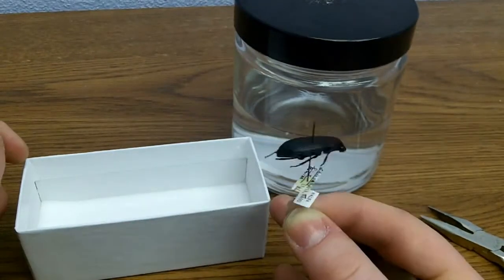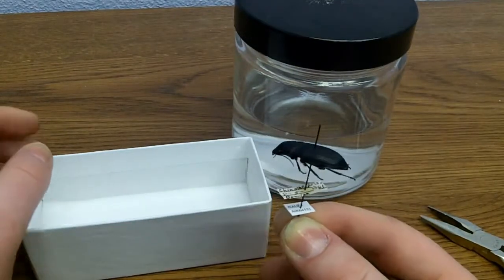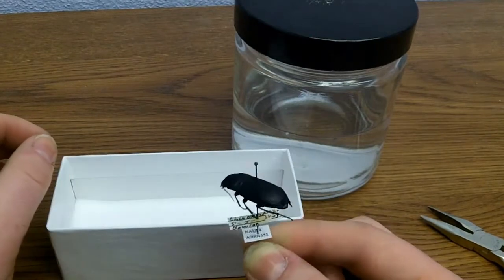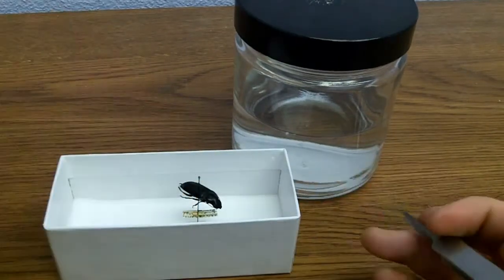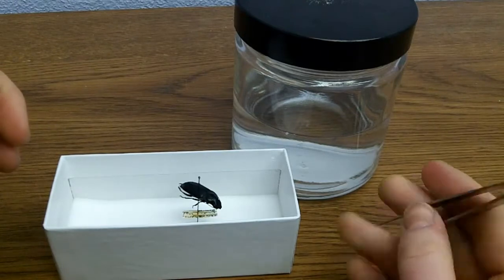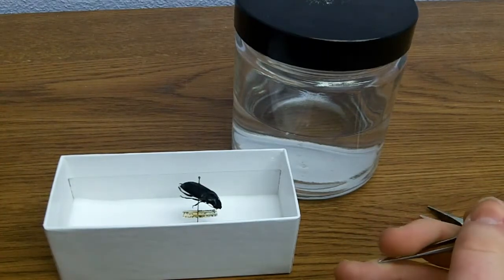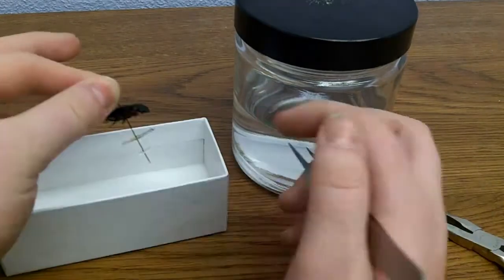Specimens such as this beetle can be cleaned without doing damage to them. Any specimen that's very delicate or not appropriate to clean, don't clean.